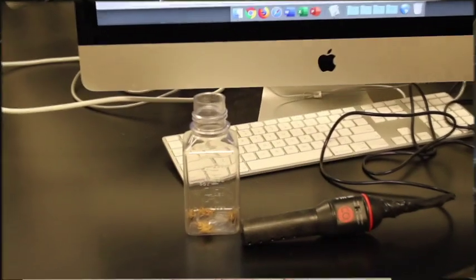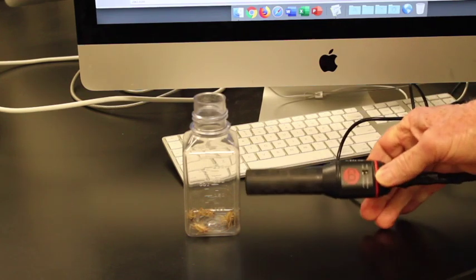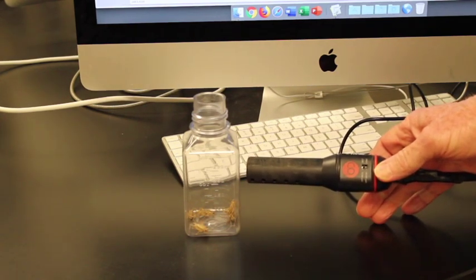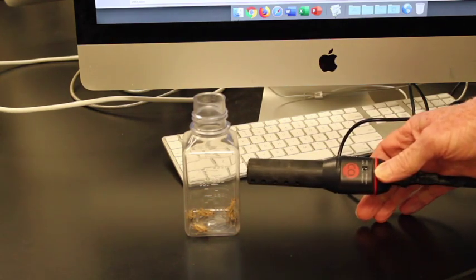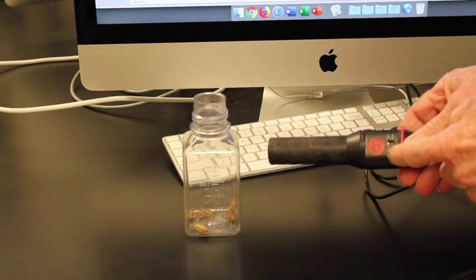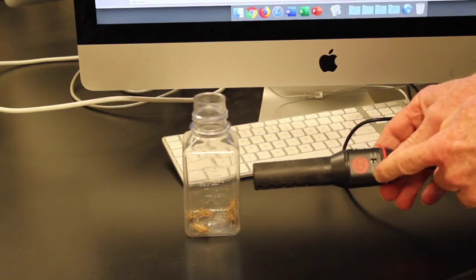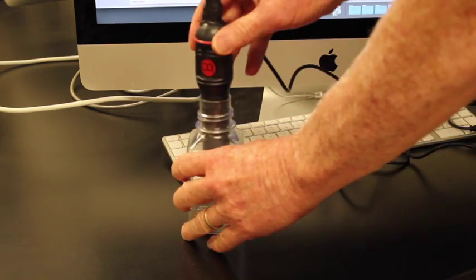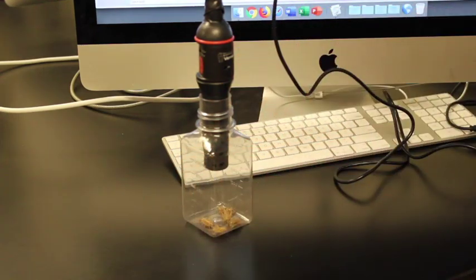So the next step then is to measure the respiration rate. In order to measure the respiration rate, we are going to need to measure the output of carbon dioxide. Respiration is a process which gives out carbon dioxide. That carbon dioxide can be measured by a carbon dioxide probe, which is going to measure the parts per million of carbon dioxide in the atmosphere. So I'm going to take this probe and put it into the chamber here. I'm going to make sure that it just stands up there.